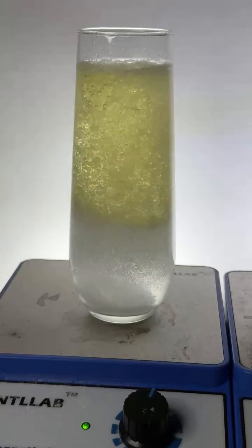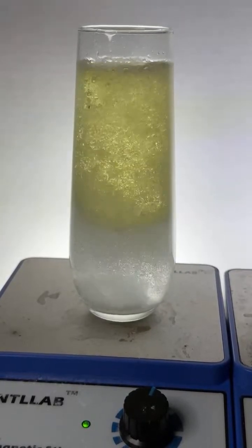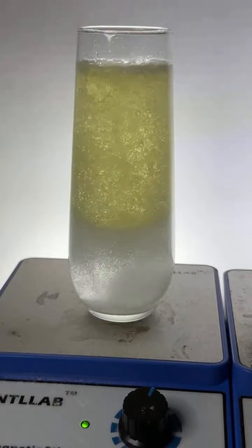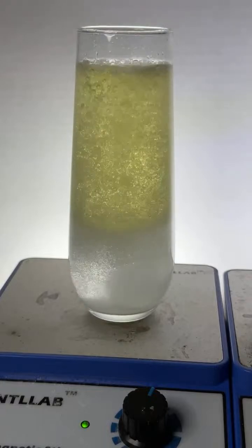What would happen if the lid was added to the glass and the CO2 wasn't allowed to escape, with just a minor pressure? Well, I imagine it would just push the lid off. If it was enough pressure, I guess it could break the glass. I'm from the United States, Nasir.